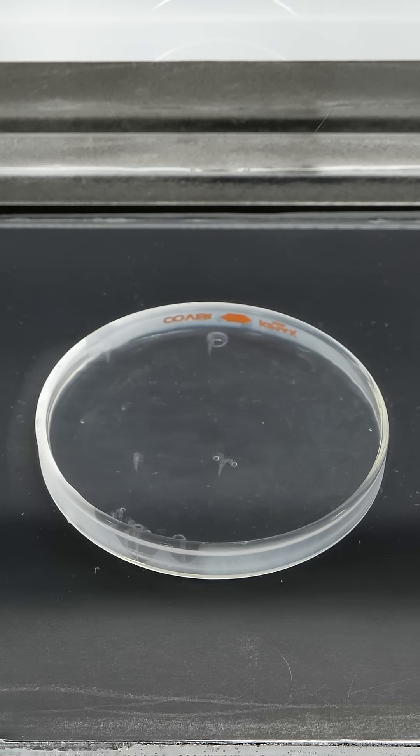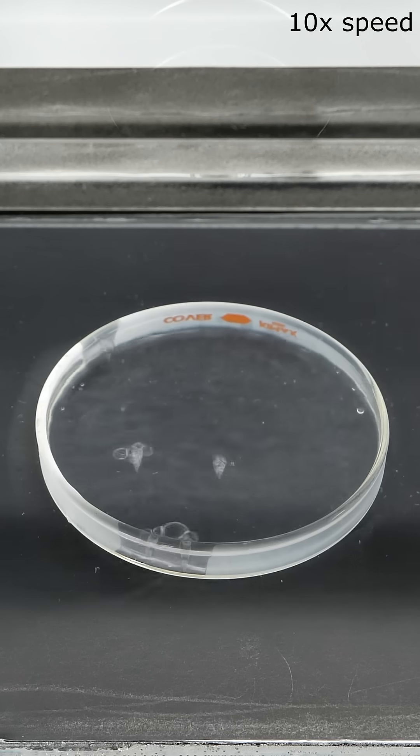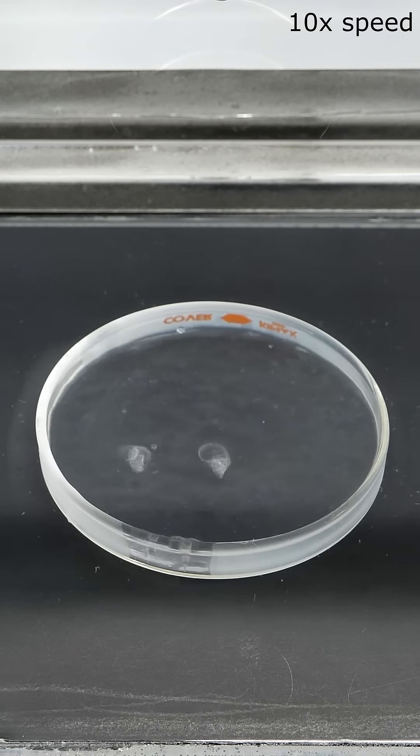Now, I'm pretty much good to go, and all I have to do is turn on my vacuum pump. The pump immediately starts pulling the air out of the chamber, and the pressure inside is slowly decreasing. This should force more of the liquid nitrogen to boil off and vaporize, and it should cause it to slowly get colder and colder.